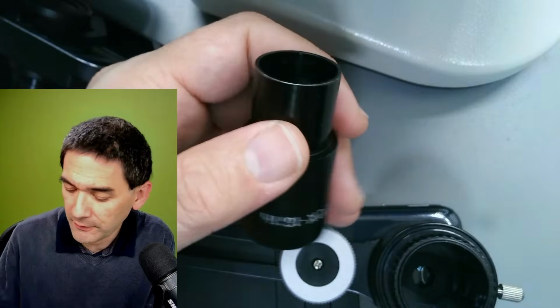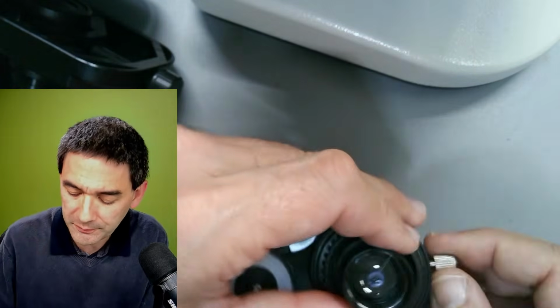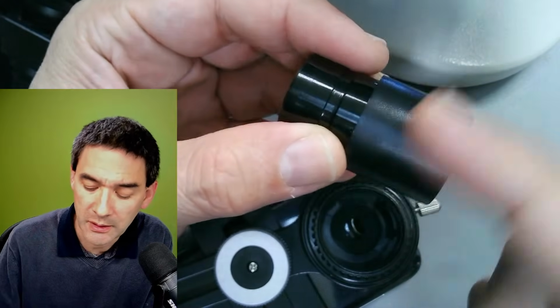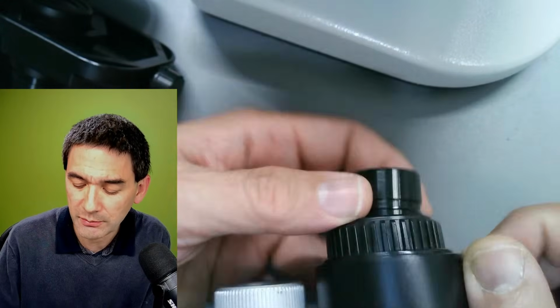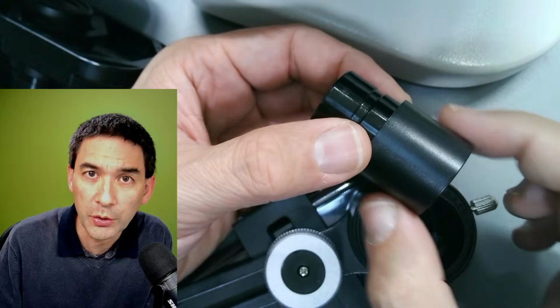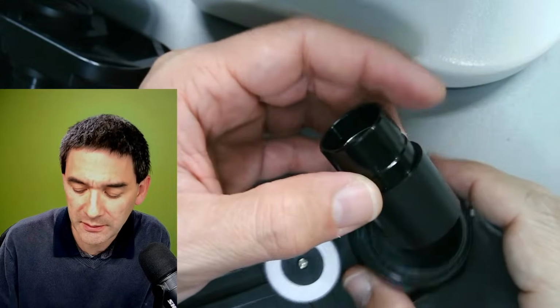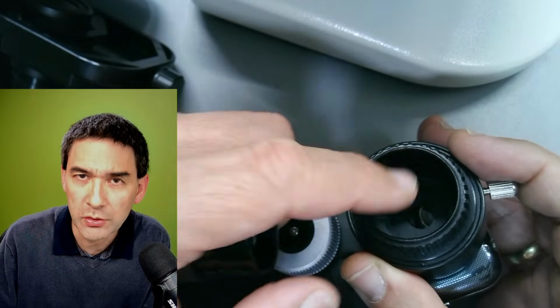I mean, look, if, for example, this one over here is a little bit smaller, if you put this one in here and you turn it, close it all the way, it's still too loose. If this is the case, then what you have to do is wrap some tape or some paper around it, and then it'll also work. So this is the eyepiece being too small. As long as it's not conical, as long as it's basically like a regular barrel, it's not a problem. You just wrap a little bit of paper or tape around it, and that'll be fine. Better being a little bit too big than obviously too small.